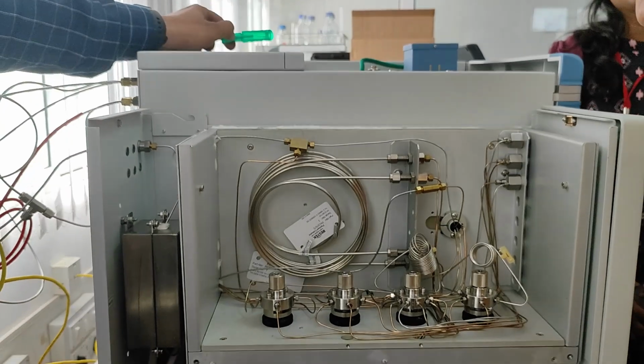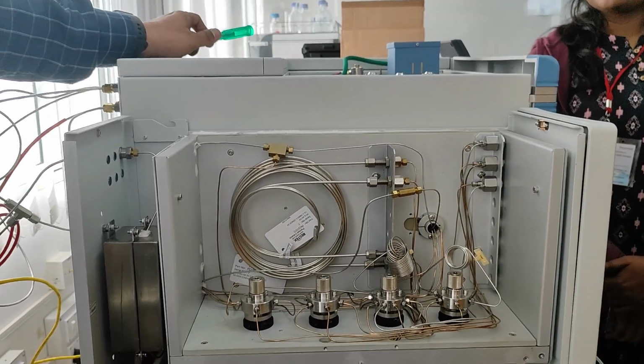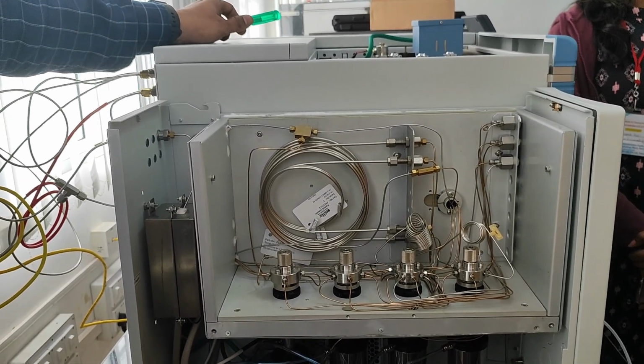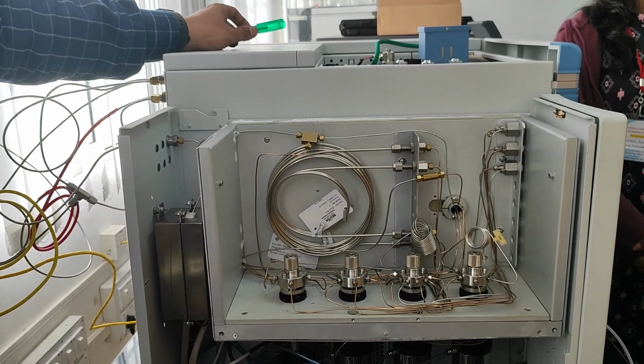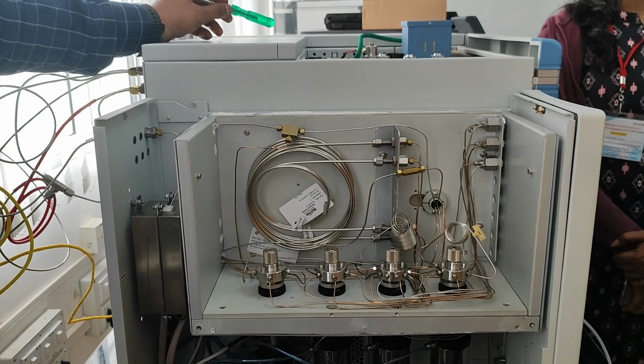Nickel. Yes, nickel catalyst. What is the working temperature of the methanizer? Above 350, up to 400. Okay. We will give 390 degrees centigrade. Why?